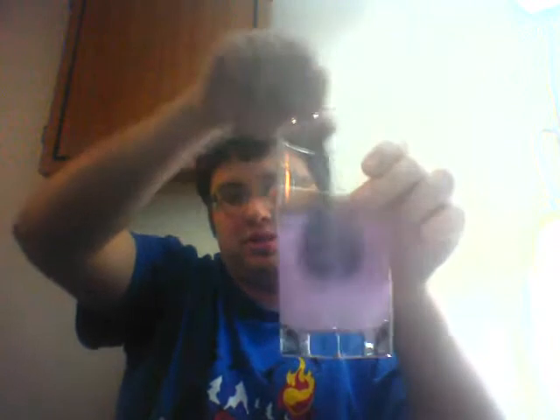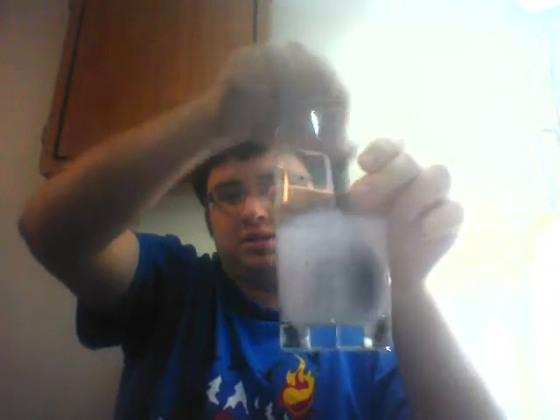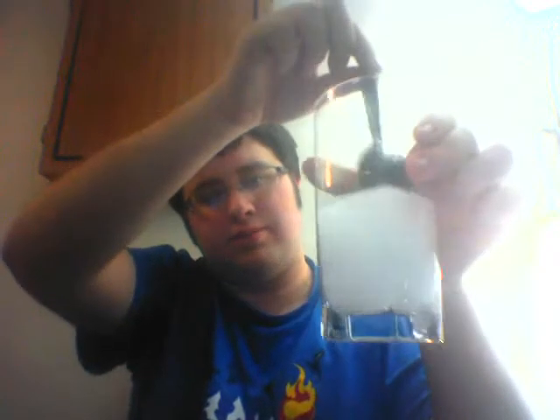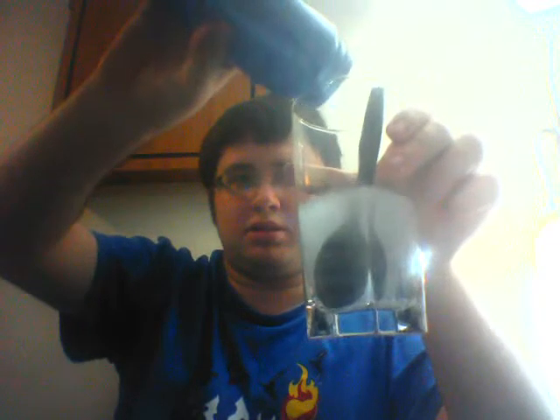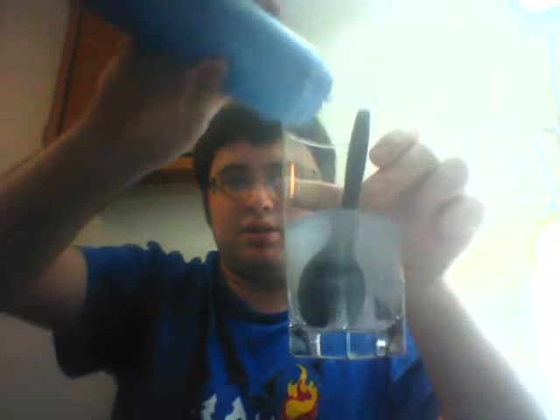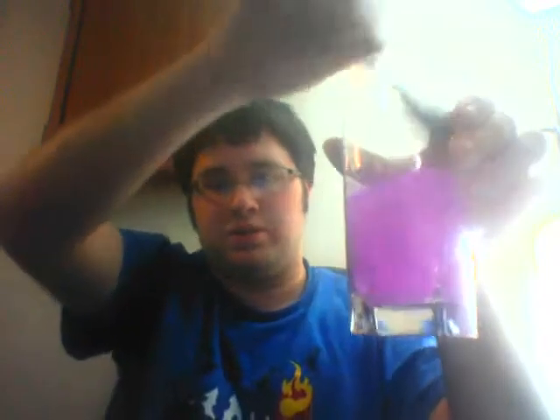What we want to do is get it back. Now it's a little cloudy because it hasn't completely dissolved. But you can see I have turned it colorless again. Now, once again, I can increase the pH. It starts off at first neutralizing the acid, but then the solution turns pink again.